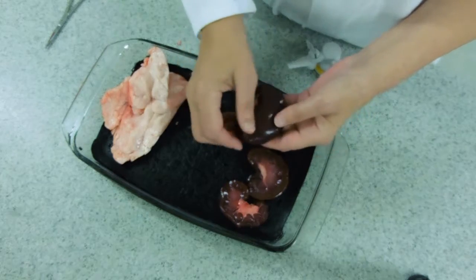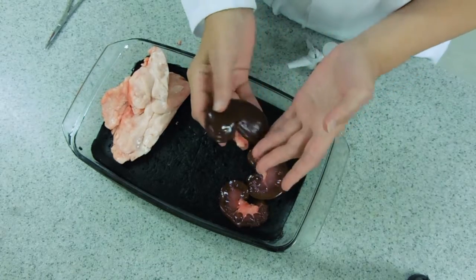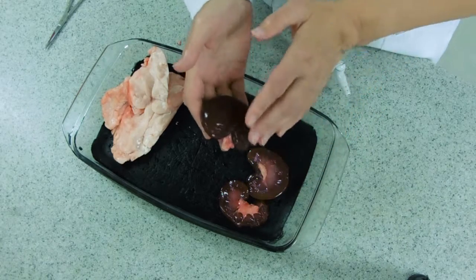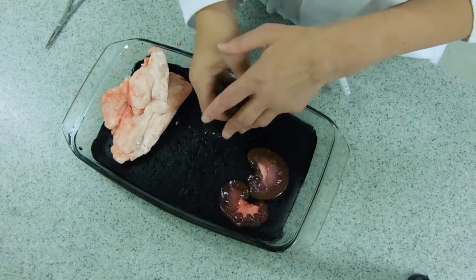You can see that the whole thing is covered in a smooth membrane, which makes it look a bit shiny. This is so that it can move around within the fat without being damaged.